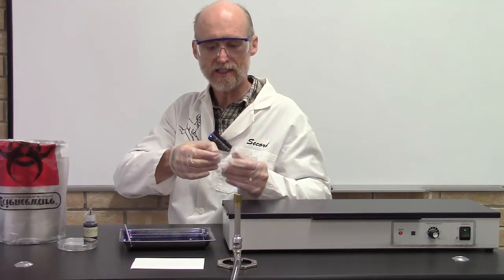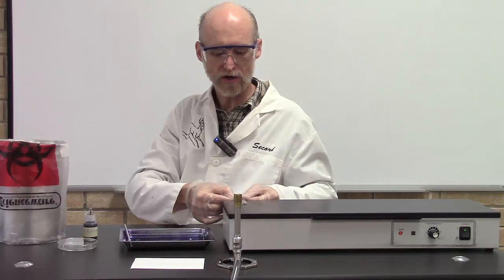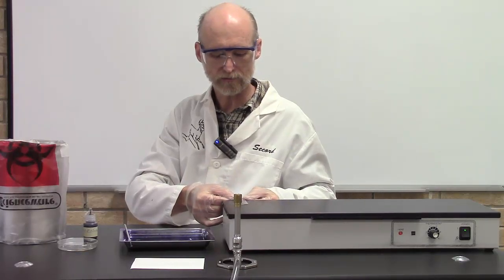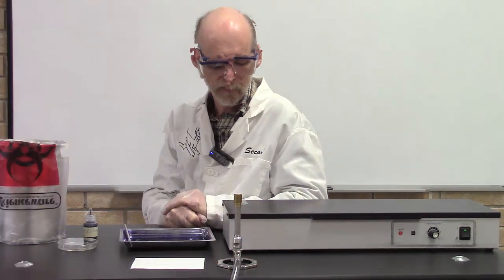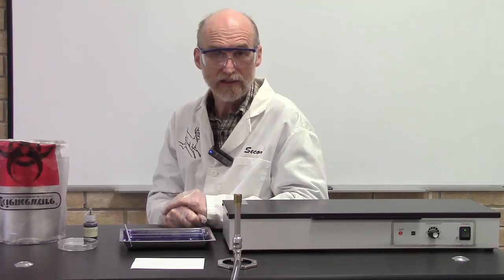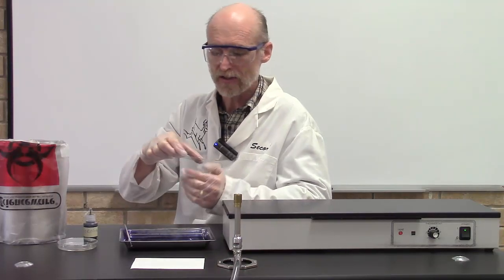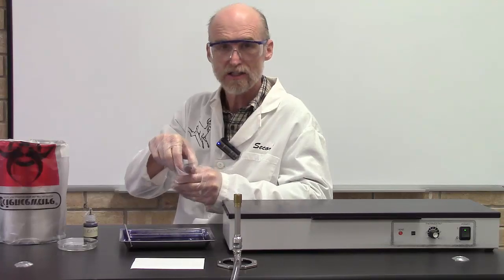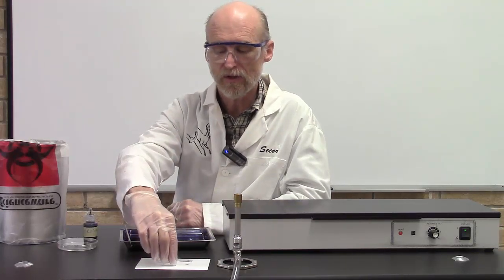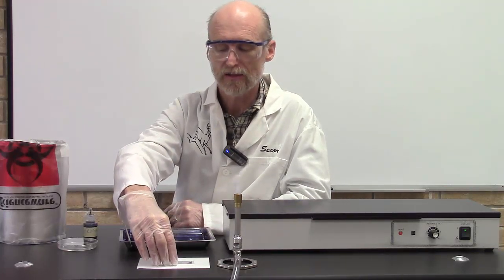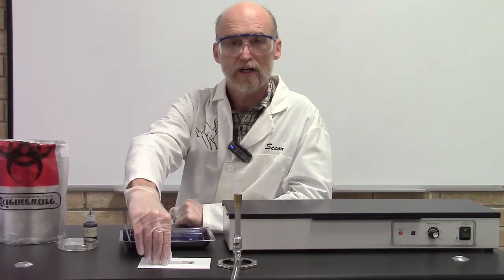Now we're going to take this and put it on our slide warmer. As the water evaporates, the dye actually bonds the bacterial cells to the slide. And you end up with your finished product. Let me put this on this bibulous paper so you can see what the final product should look like. There you have it.